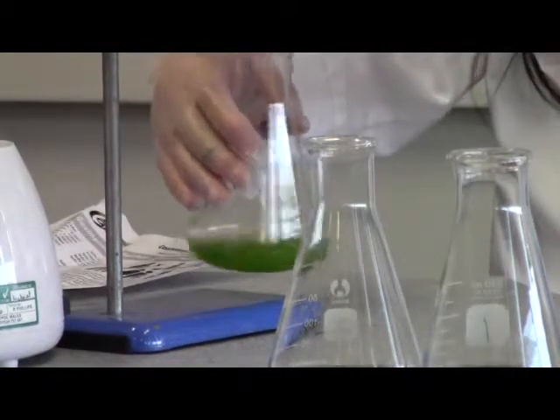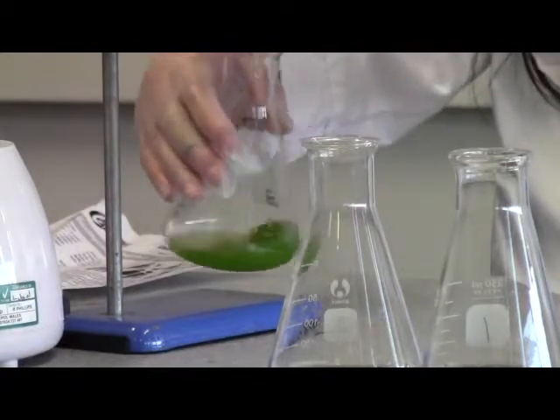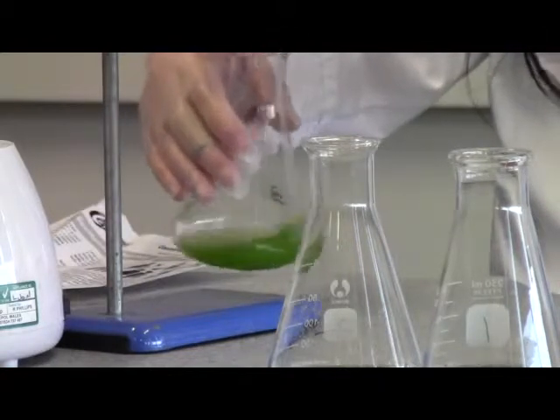After titration is completed, I will sit down to organize my data collection. So at the moment, you just concentrate on titration.